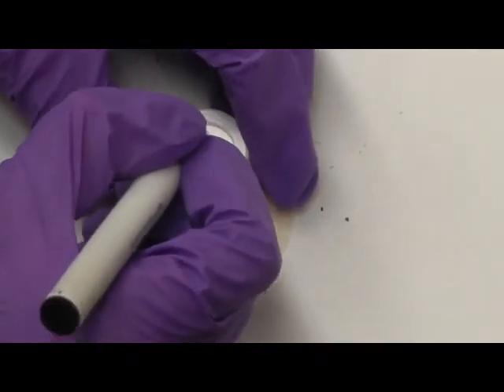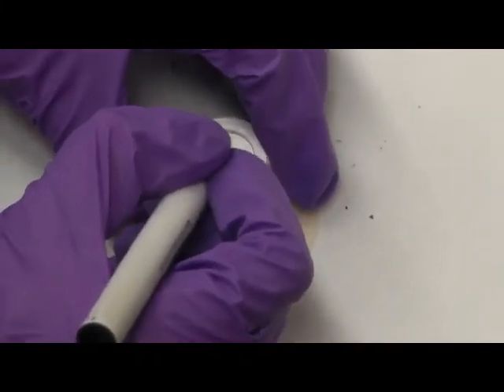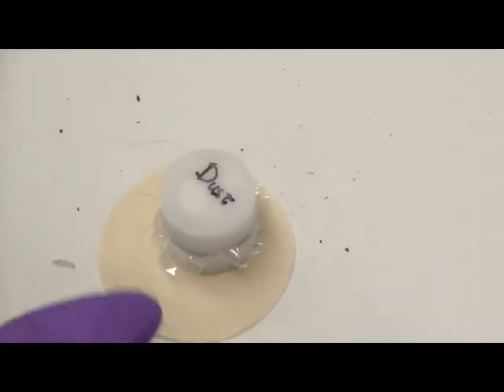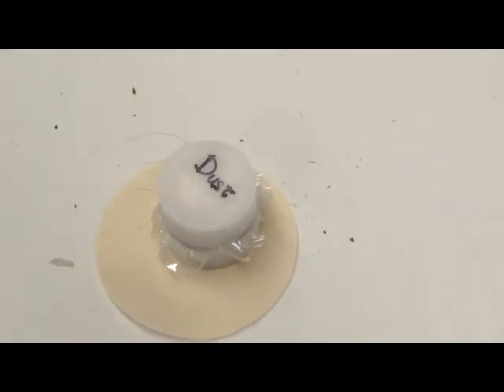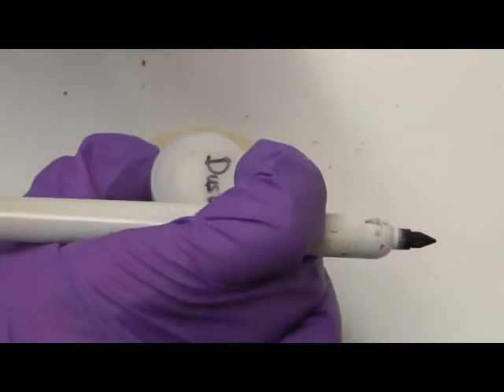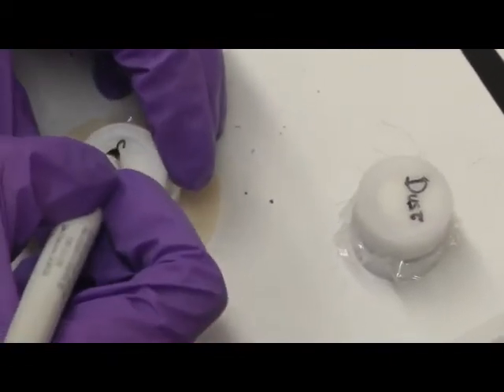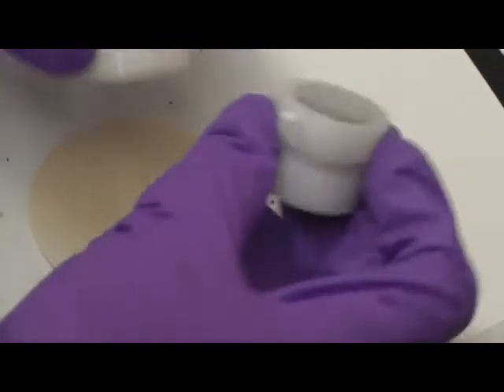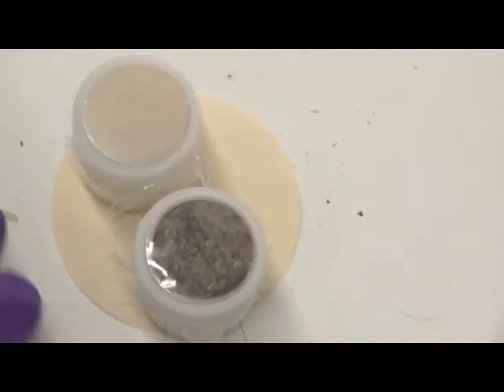So we can label each sample. This sample is dust, so I'll just label it as dust sample. And if there are multiple soil or dust samples, it can be labeled as dust number one, dust number two, etc. And this is our soil sample. So, soil and the dust.